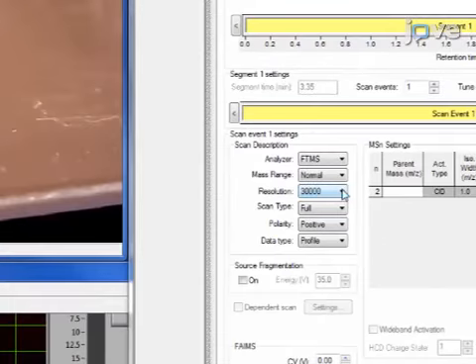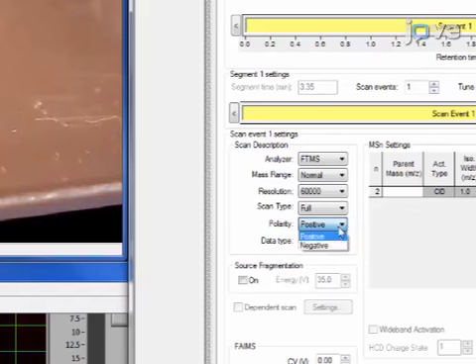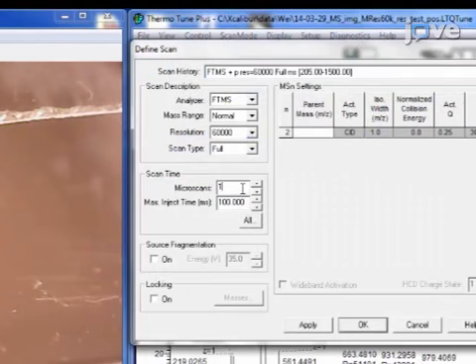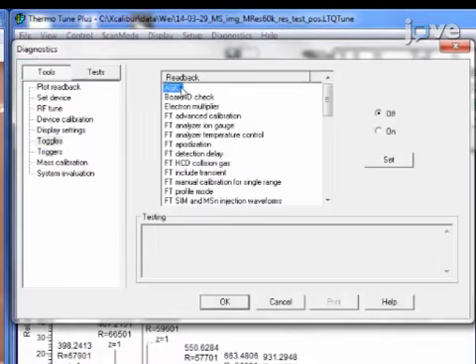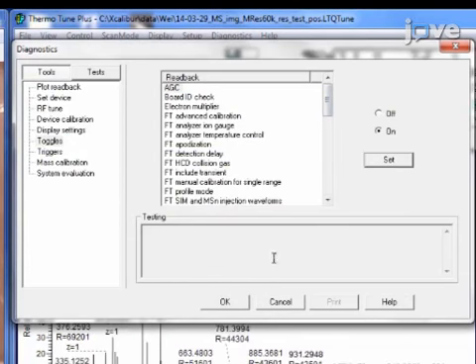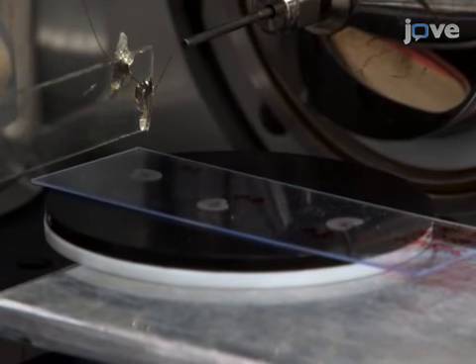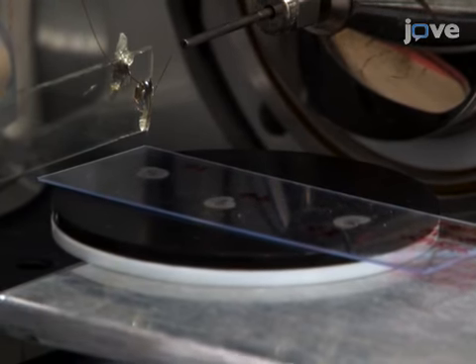For high mass resolution MSI on a mouse kidney sample, use a mass resolution of 60,000, a 5 kilovolt positive mode, 1 microscan, 150 milliseconds maximum injection time, and automatic gain control on. Initiate the MSI data acquisition and then construct MS images from raw MS files as described in the text protocol.